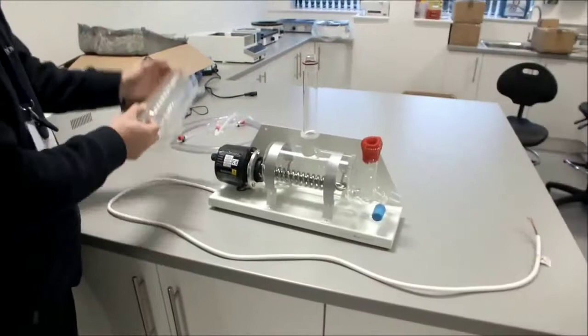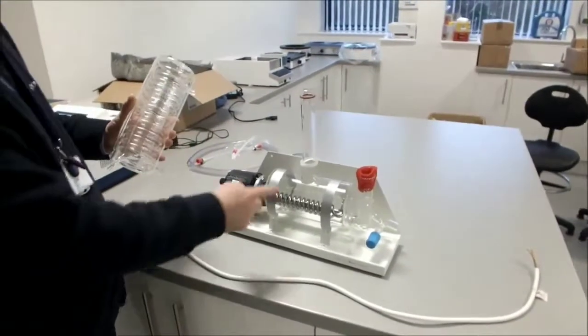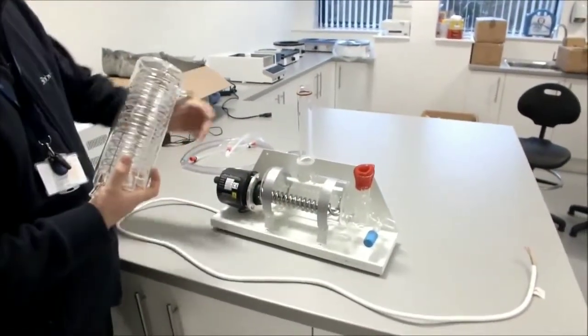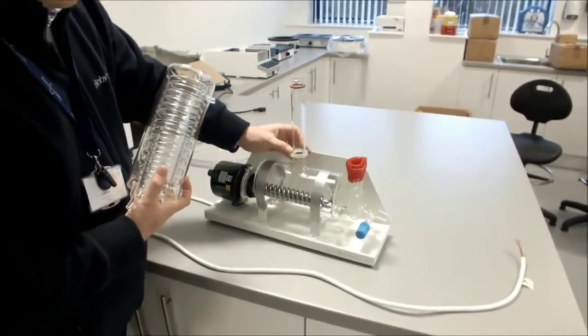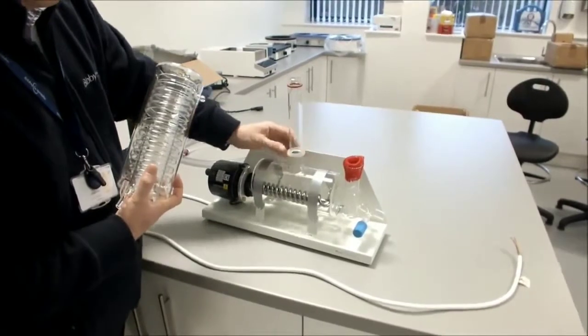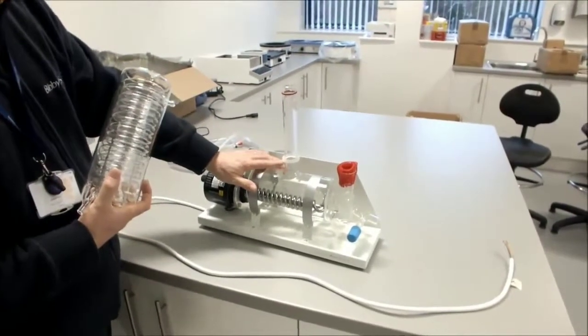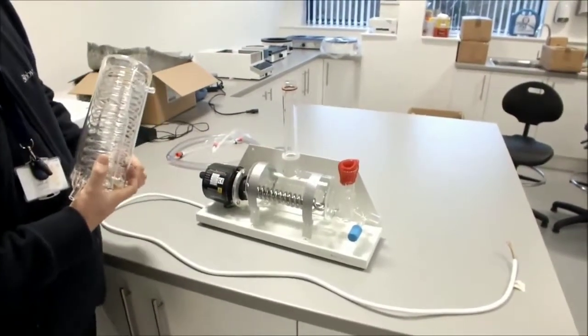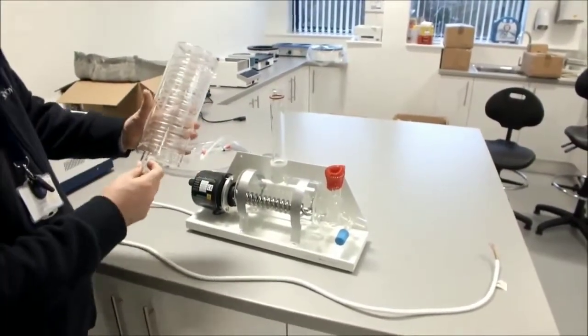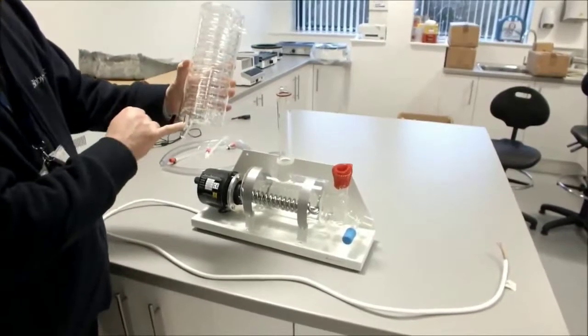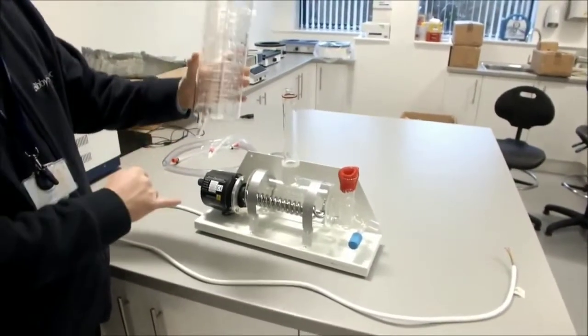We can then connect our condenser to the vapor tube of our boiler. Firstly check that the sealing o-ring is fitted correctly as well as the stabilizing o-ring. The stabilizing o-ring should be about 30-40mm up from the boiler. You check them, move on to the condenser. When we fit this, we make sure that the distillate output is facing the front.